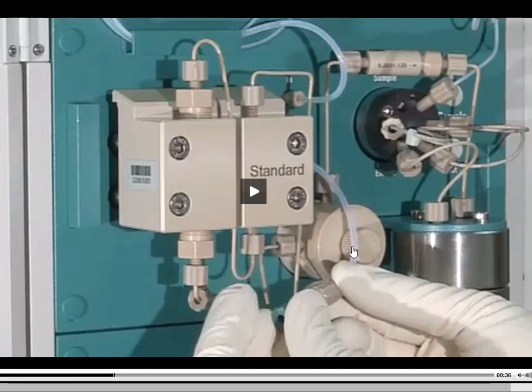You know, it's kind of like siphoning gas. If you've ever had to do that and you've run out of gas and you have that gas container, you put the hose down into the gas container and you suck on the hose until you create some of that suction, and then you can jam it down into your gas tank and it just flows naturally right from that point on, if you do it the right way. The same thing is happening here. So we need to put a cap onto that tubing. If not, it's just going to constantly flood. My mobile phase is going to go everywhere, and I'm just wasting it.